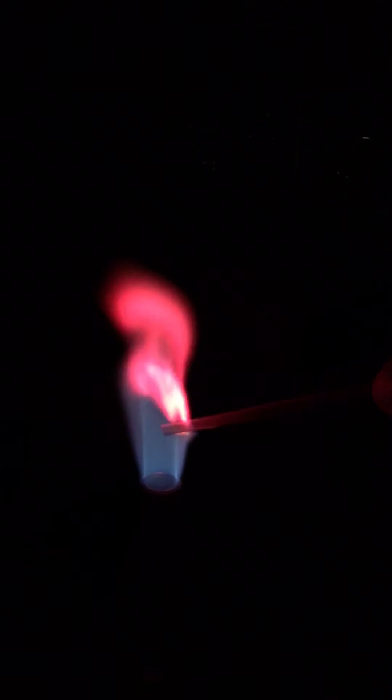That was unknown one. Now I'll show you unknown two. Here we go for unknown two. I think that color needs no explanation — it looks like a reddish, very vibrant red, almost like fire engine red.